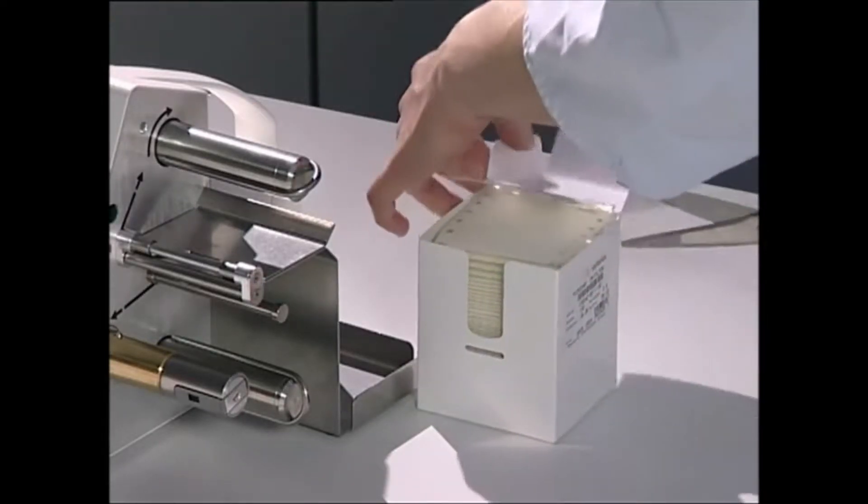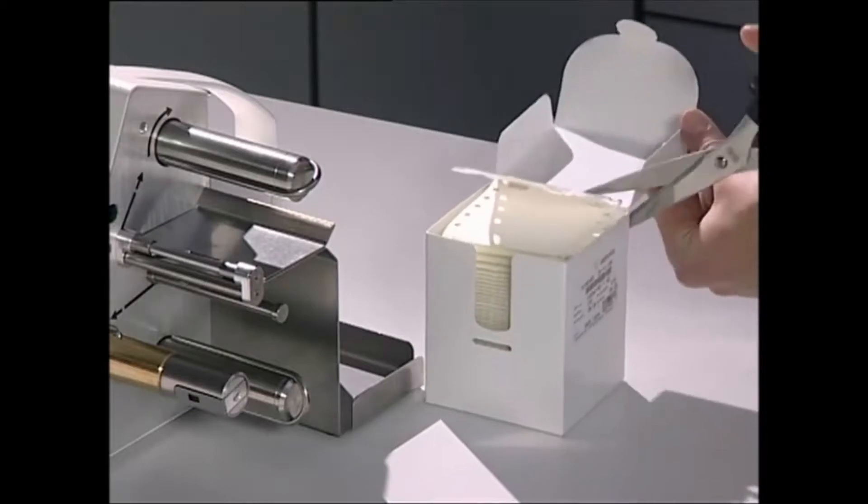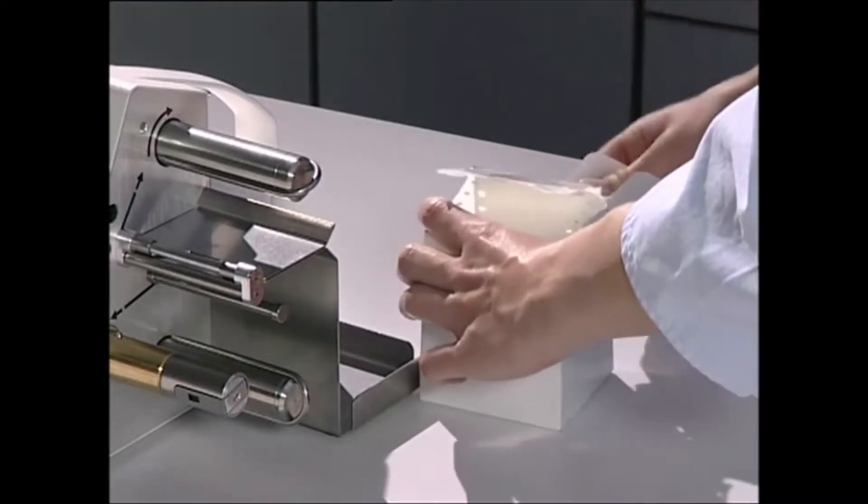Open the membrane filter box, flip up the cover or tear it off, and place the box in the holder on the dispenser.